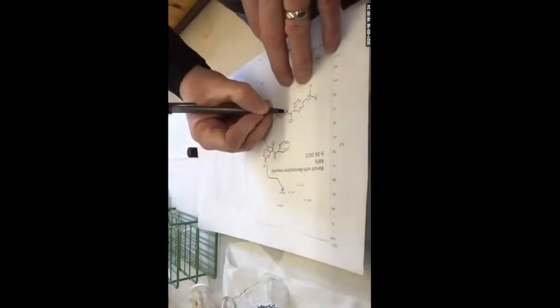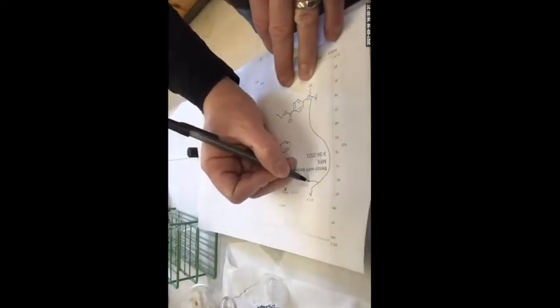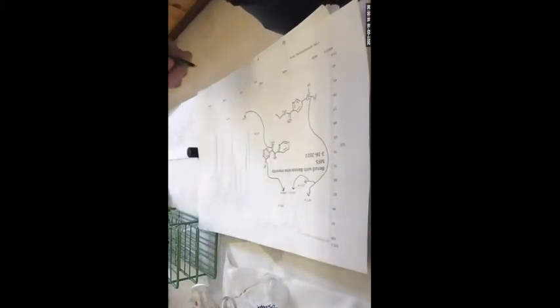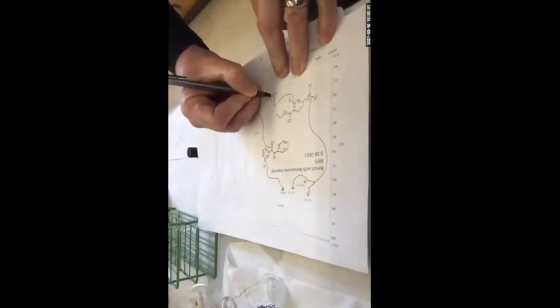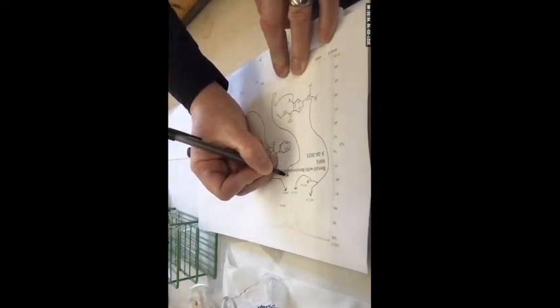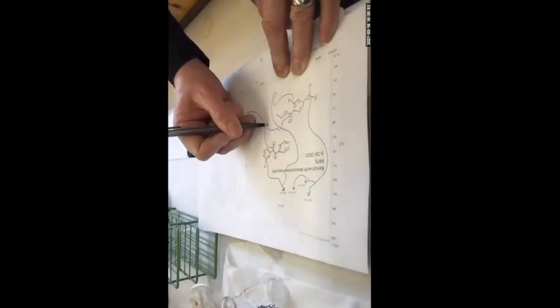So there's some benzocaine in here as well. So the NH shows up as these 3. And then the sp2 carbon hydrogen, same spot as the other one. And then there's a carbonyl. Hop over that one.